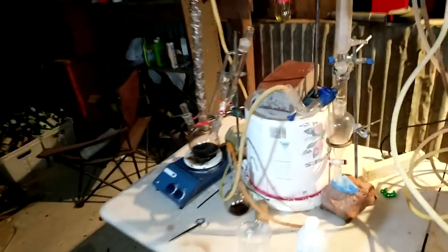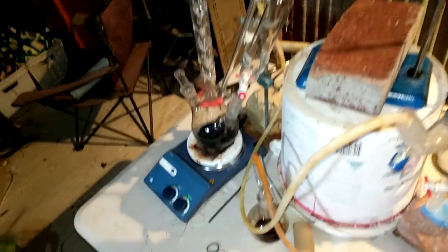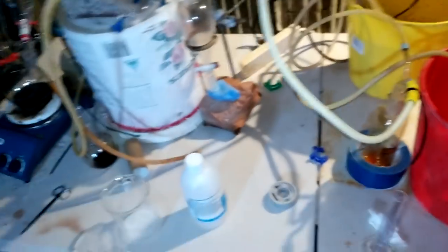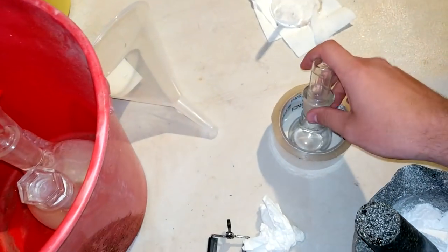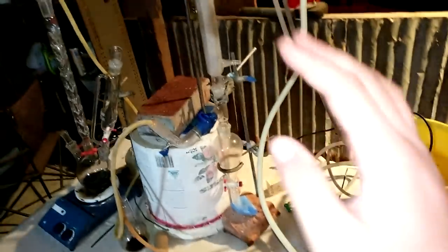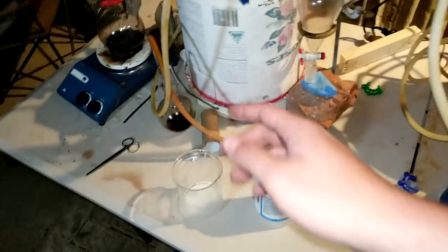All right, we're drawing to a close. I've added all the tertiary butanol. That was 25 mils since I got it working. I added 50 mils of tertiary butanol before we got it working. So we really just wasted those 50 mils. This is our yield here, and which I think is quite reasonable and definitely enough to distill. So I won't make too many predictions because last time I got very excited before we measured the boiling point and then we measured the boiling point and it was not the product we want at all. But I gotta say, in all my years of doing experiments, I've never had an experiment turn around as dramatically as this one has.